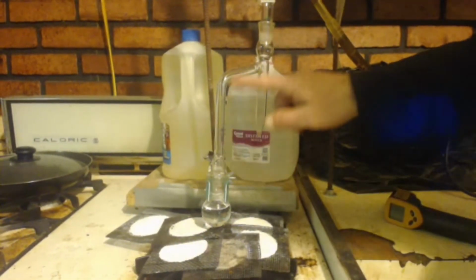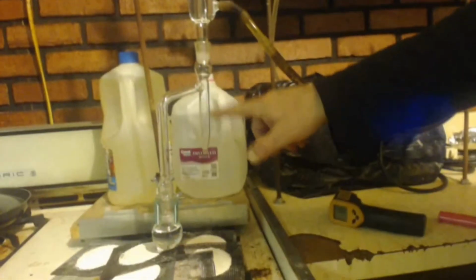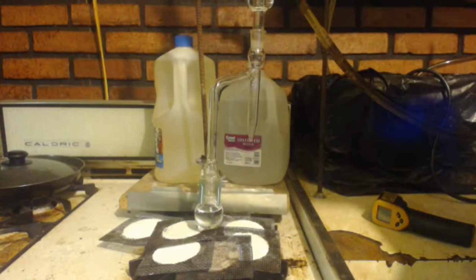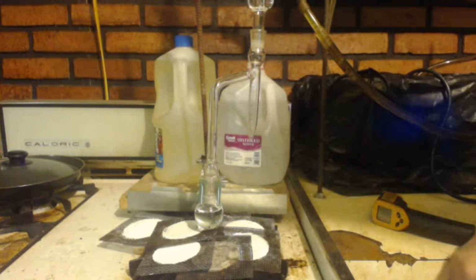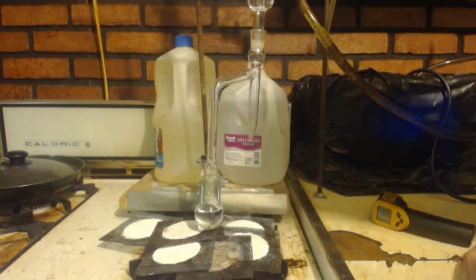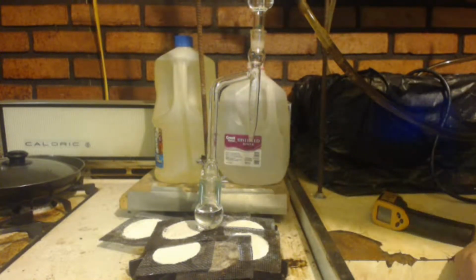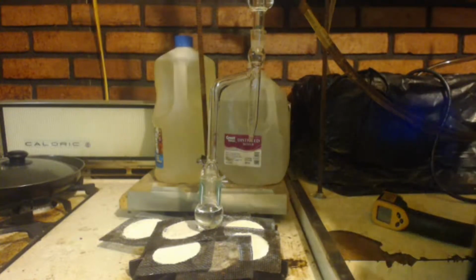You can see it's the same dealio. I'm going to distill it up. I got my water cooled condenser. Everything will come down into here and fill up and separate into two phases. Now there's about 21 milliliters in there. Say 30% of it is water, then there should be 7 grams of water in there, or 7 milliliters. So we'll see first if this bites me in the ass for filling it up so high, and also how much water is still in there.